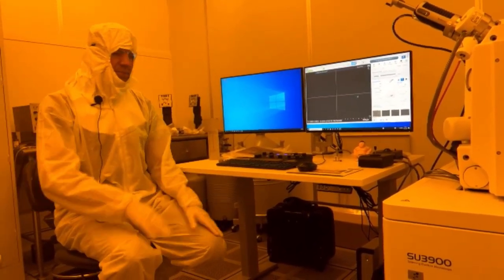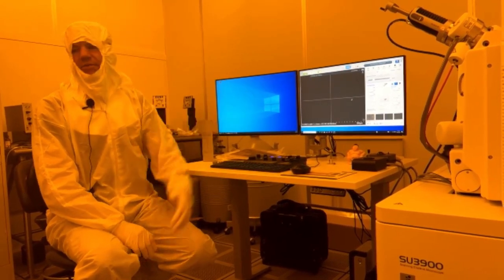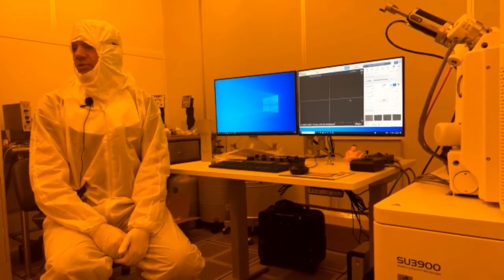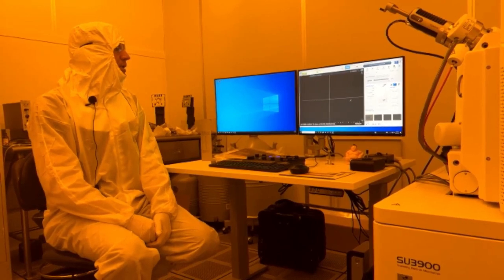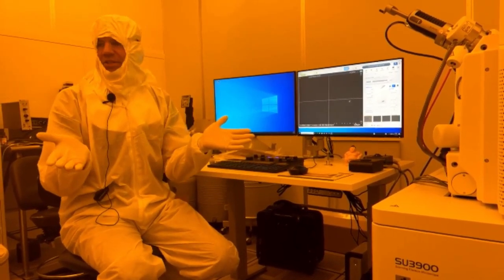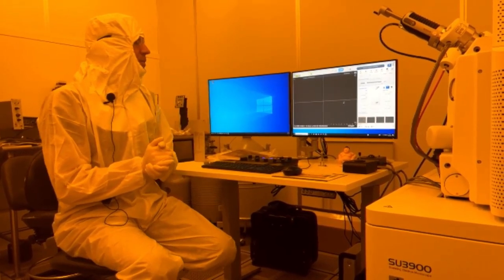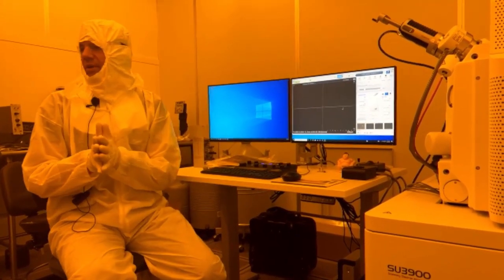And then the startup is just the reverse, right? We went over that earlier. Turn the key on, start the software, and load your sample. So that pretty much covers the basic training, basic operation. I can go over the filament replacement.